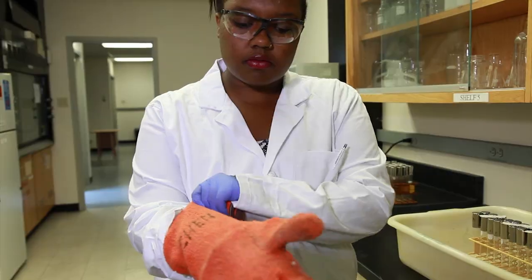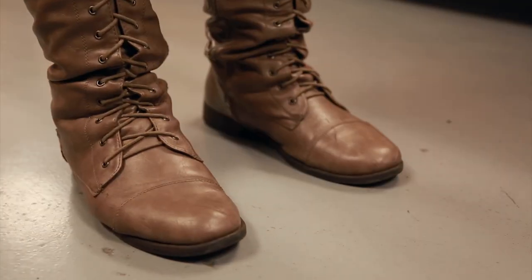Module 3, Loading an autoclave. Before loading the autoclave, make sure that the autoclave is ready for use by going through the following checklist. One, wear appropriate PPE to protect against scalds and burns, lab coat, eye protection, heat-insulating gloves, and closed-toed shoes.